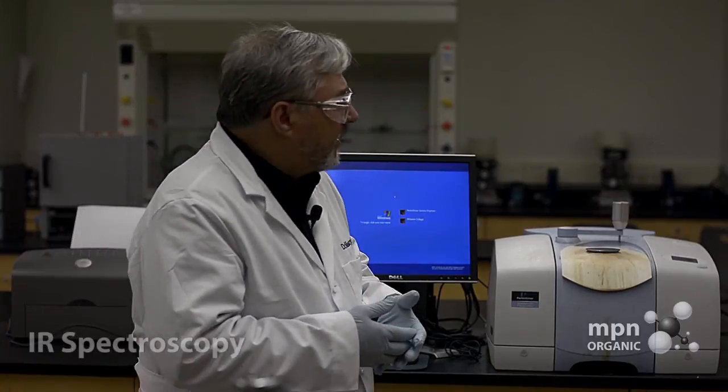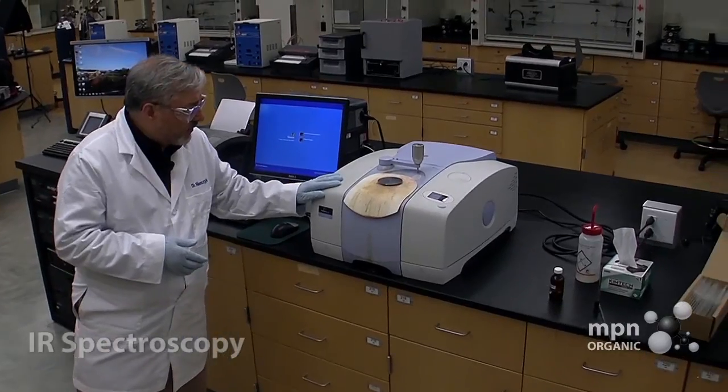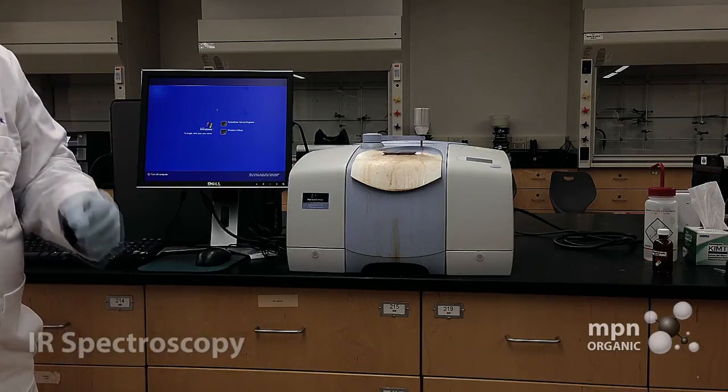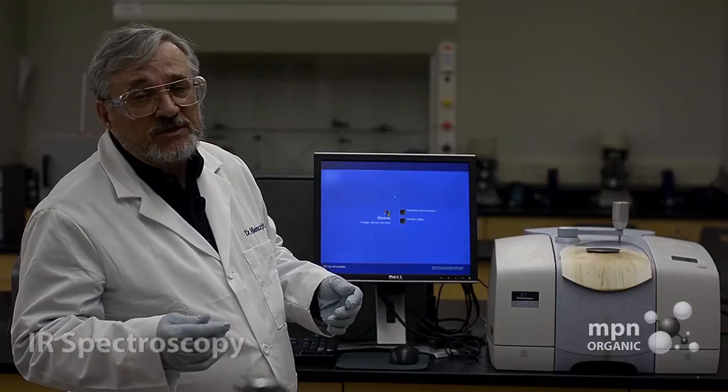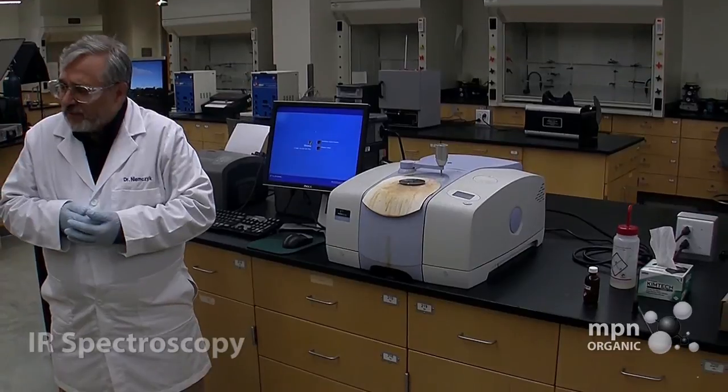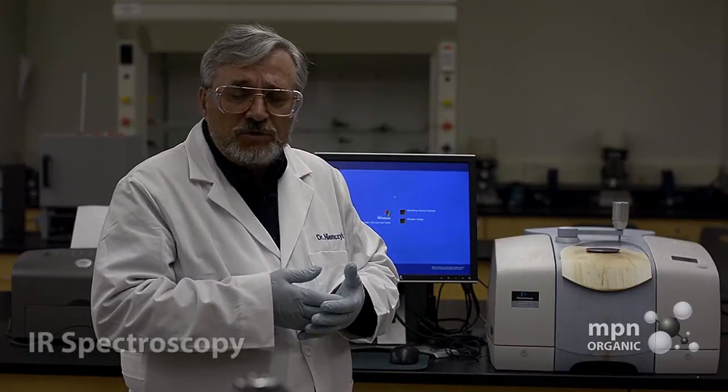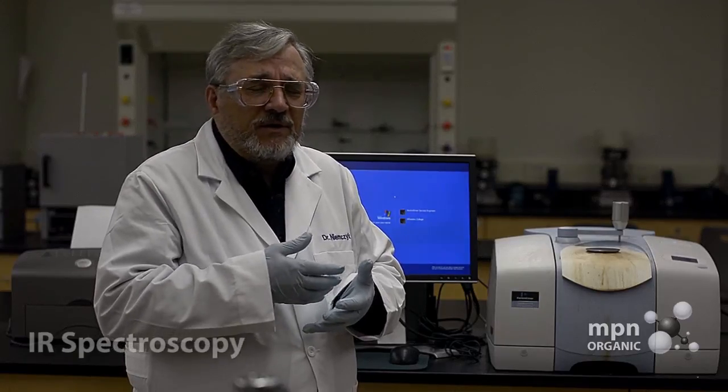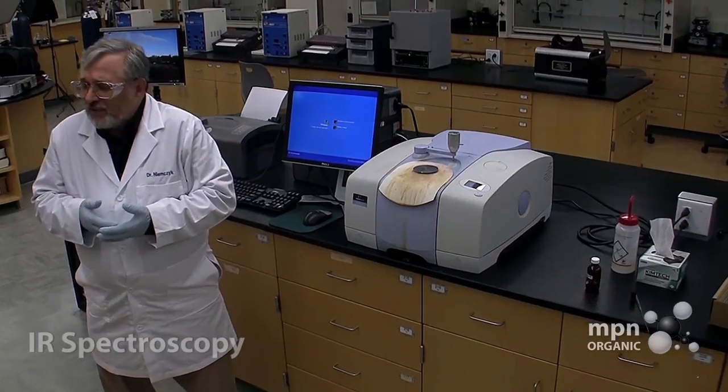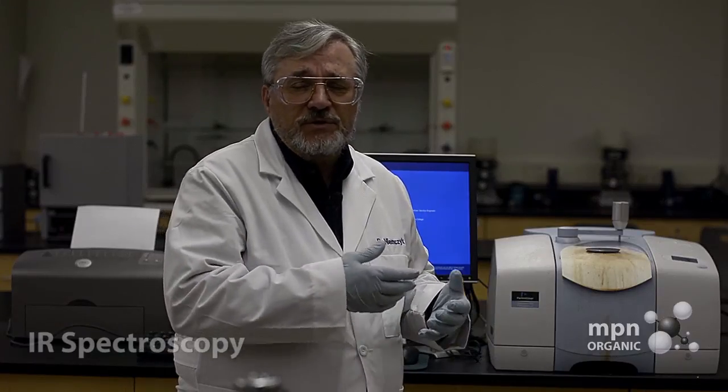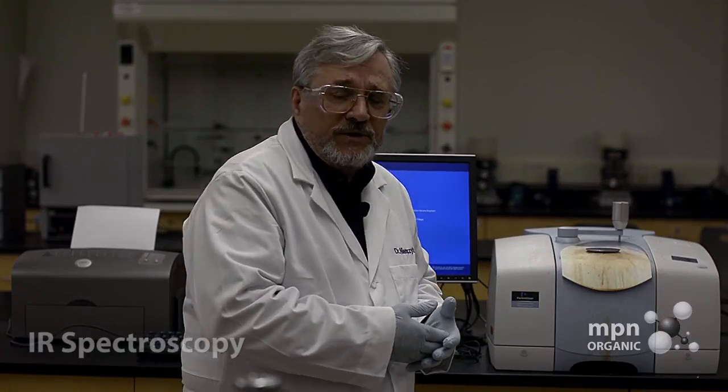And we have at our disposal here a Perkin-Elmer infrared spectrophotometer. This is really a great instrument and it is very easy to take an infrared spectrum of an organic liquid. Now what I say for an organic liquid is going to also obtain in most respects for an organic solid. What I say about a liquid is going to largely carry over to that of a solid.